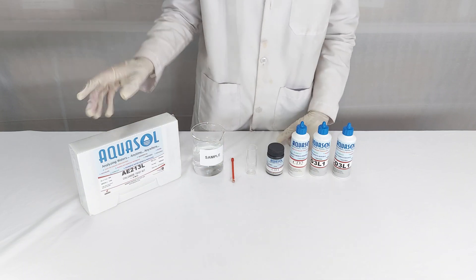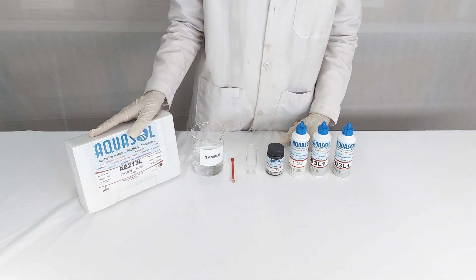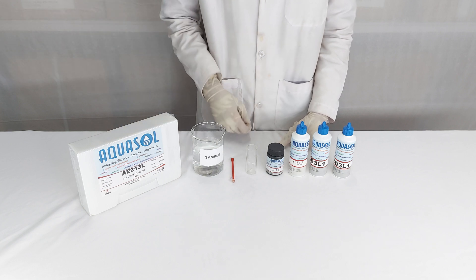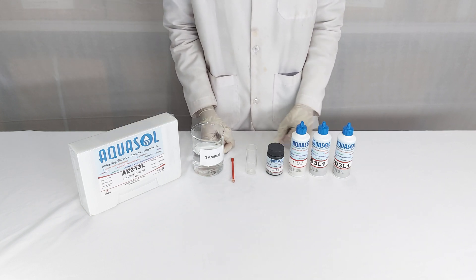We are demonstrating a chloride test kit. The Aquasol AE213L test kit is used to check chloride in water samples.